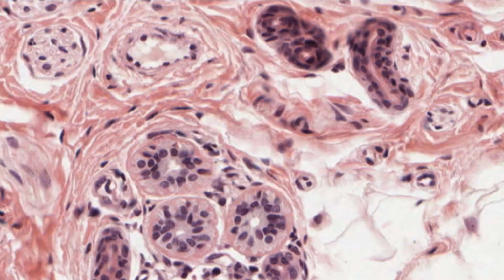The ducts are derivatives of the epidermis and retain their stratified character by consisting of a double layer of dark-stained cells, best observed in transverse sections. The secretory cells are larger and paler than the duct cells. Some nuclei of the secretory portion are dark, while others are pale, and the two sorts of nuclei lie at different heights. Since all of the cells touch the basement membrane, the epithelium is pseudo-stratified.